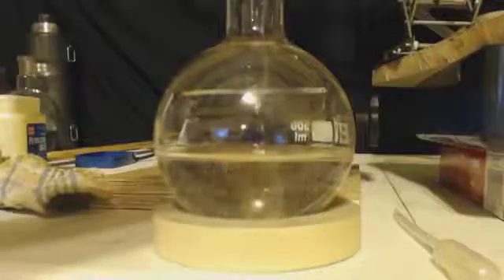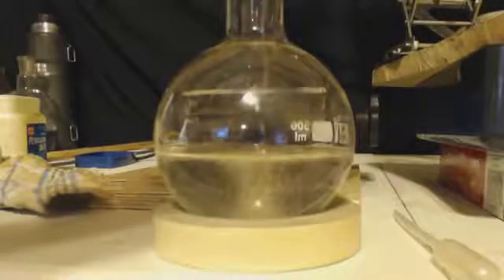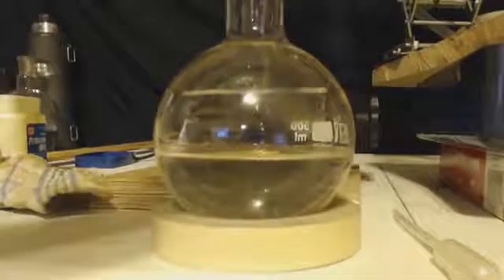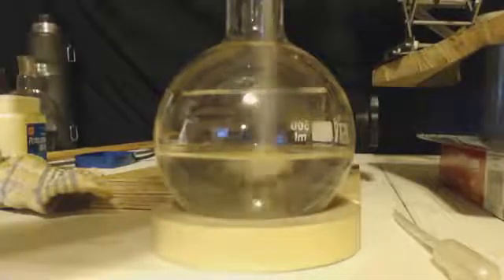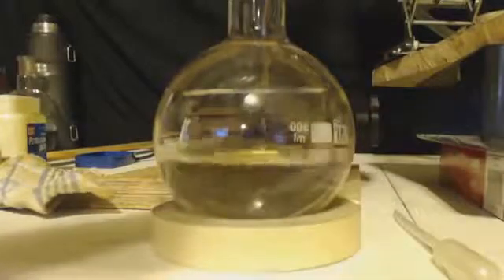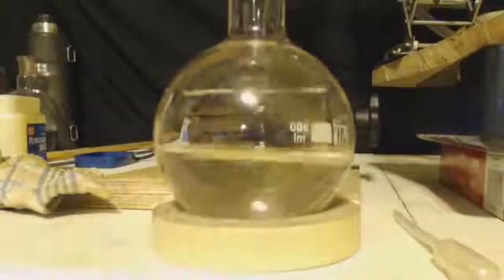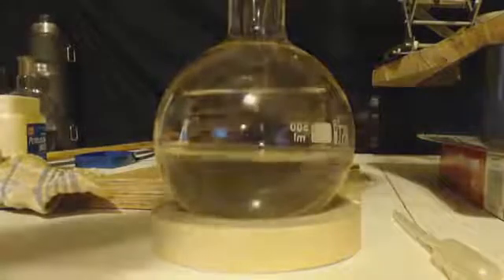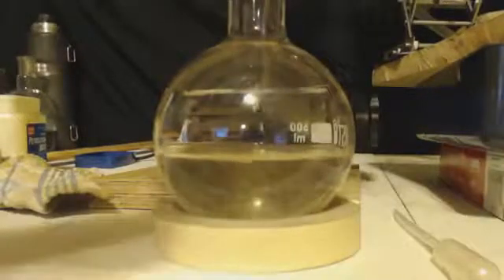There's my ethyl hydrogen sulfate. Basically, all I'm going to do is add in my salt, my sodium bromide. I have half a mole, 51.5 grams. And when I add it, very little happens, a little bit of bubbling, no temperature rise or anything like that. But when I start to heat it up, it does turn to a yellow due to the sulfuric acid. It oxidizes it to bromine and gives it that little bit of color. It will turn orange later on. You can see my bubbler there working, but it will turn oranger and then almost red at the very end.